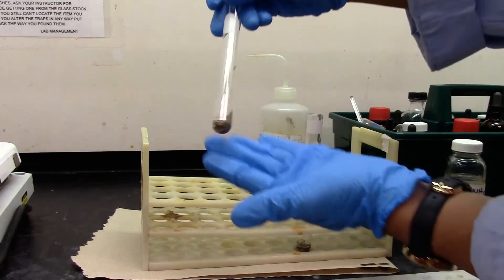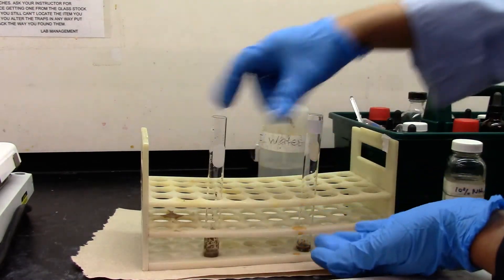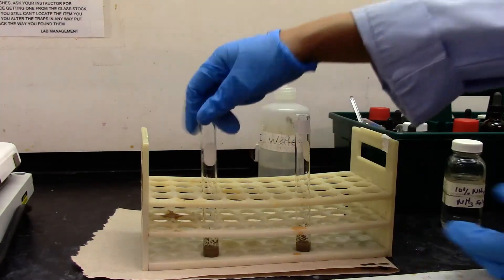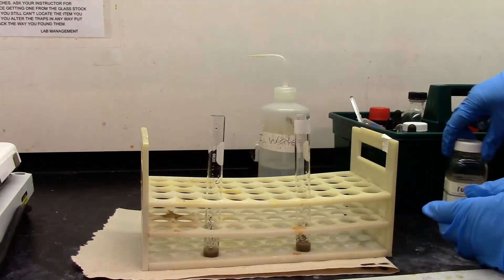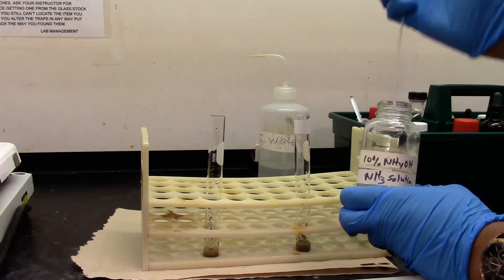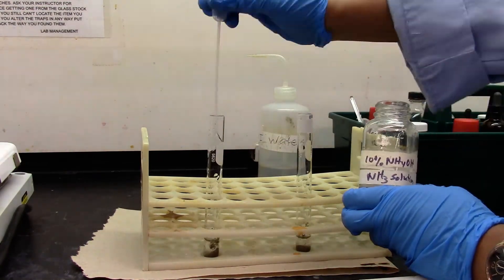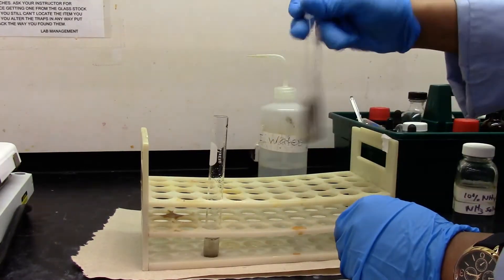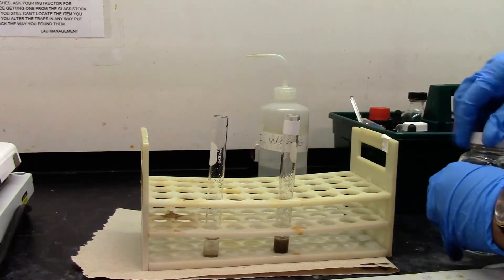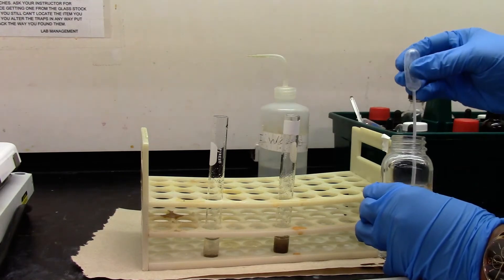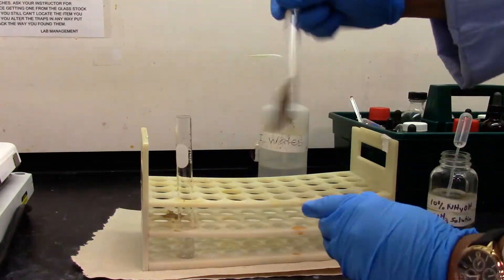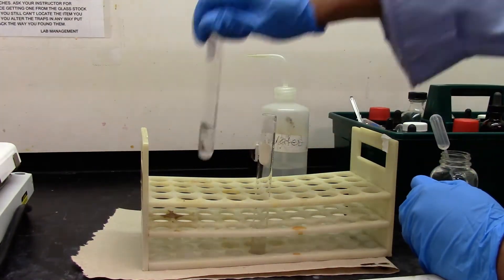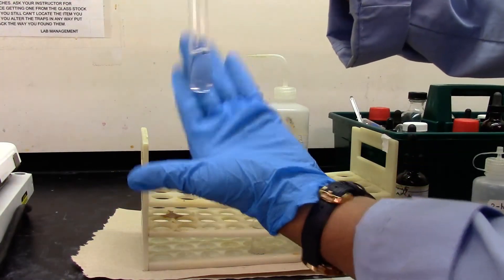It forms gray colored silver oxide in both cases. I will dissolve the silver oxide using dilute ammonia. Give it a mix. We need some more dilute ammonia.